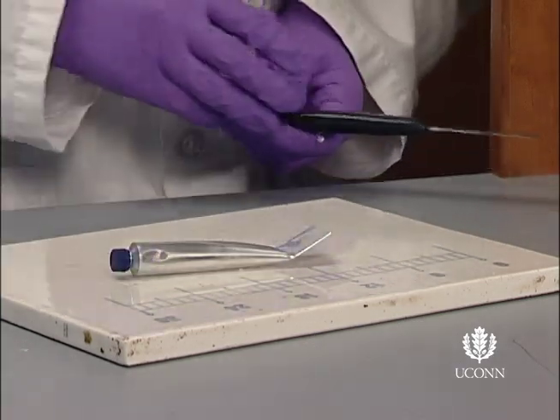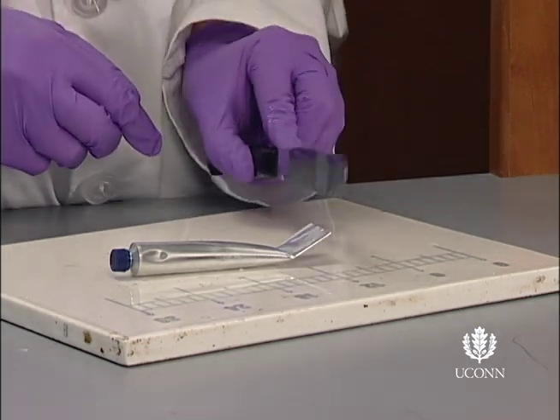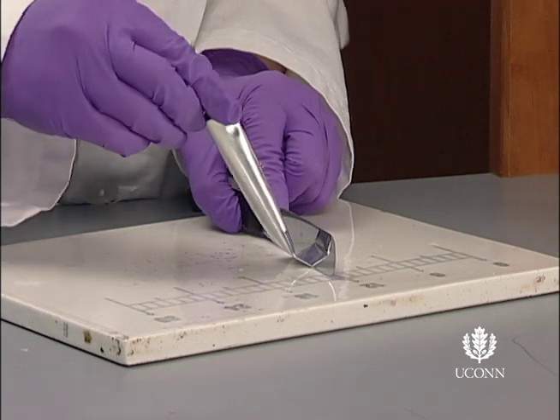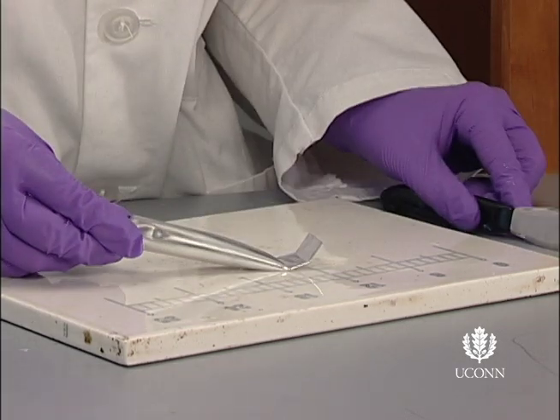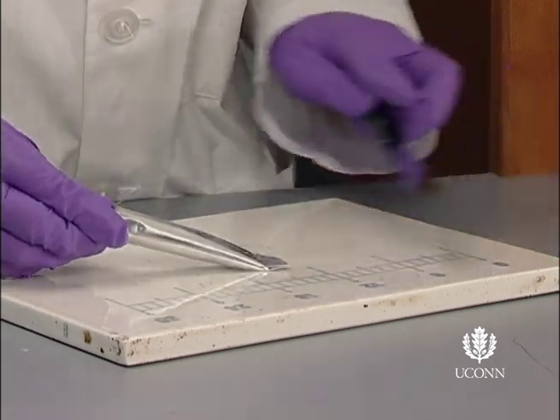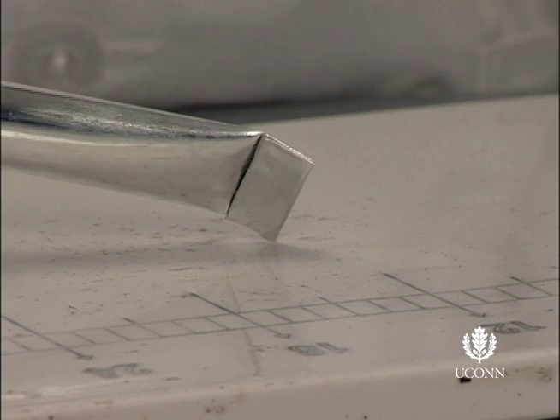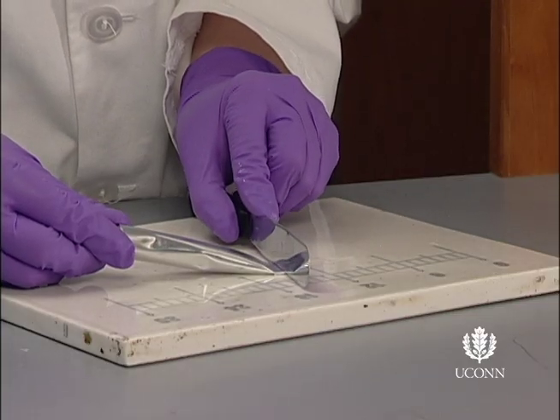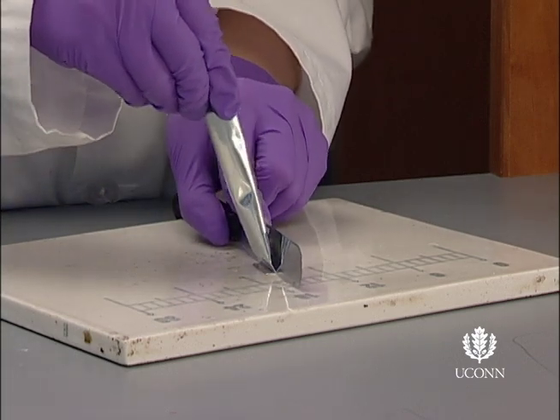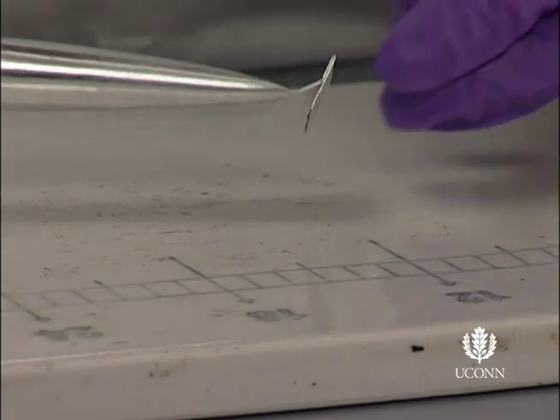Use the edge of the spatula to create a crease halfway between the previous crease and the end of the tube. Fold this crease and flatten with the spatula. Flip the tube over. Use the edge of the spatula to make a crease halfway between the previous crease and the end of the tube. At this point, the side view of the tube will reveal a T. Pinch the flaps of the T down to finish sealing the tube.